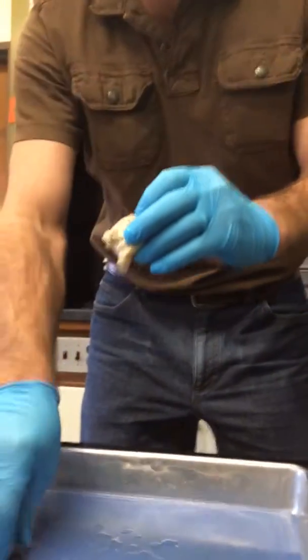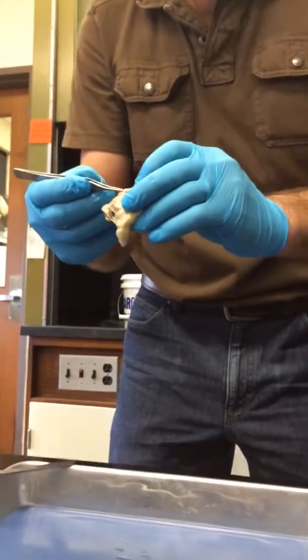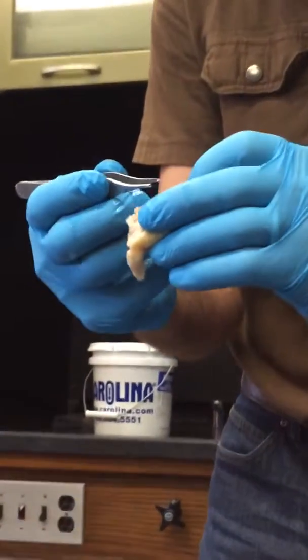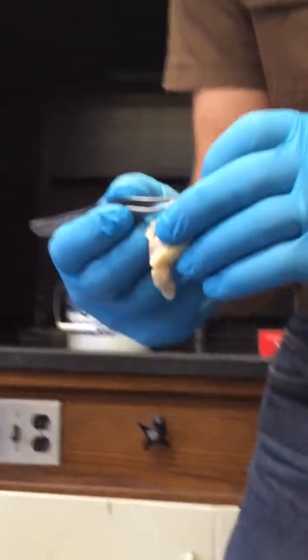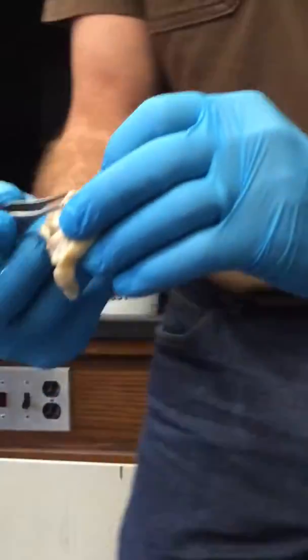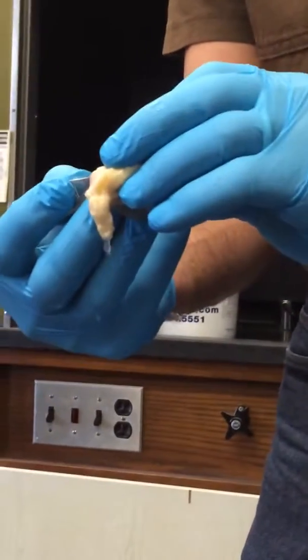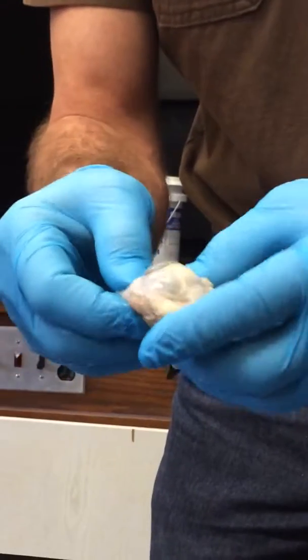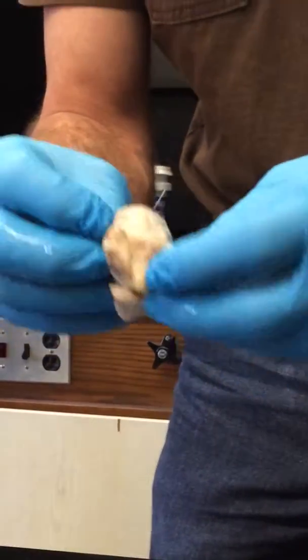Yeah, and so you can see that on here, this small, relatively. Look at how big. Now you remember the couple of nerves that we saw in the sheep brain. That's the optic nerve sticking out the back of the sheep eye right there. It's a massive nerve as far as things go. You know, got to move a lot of information through that nerve.